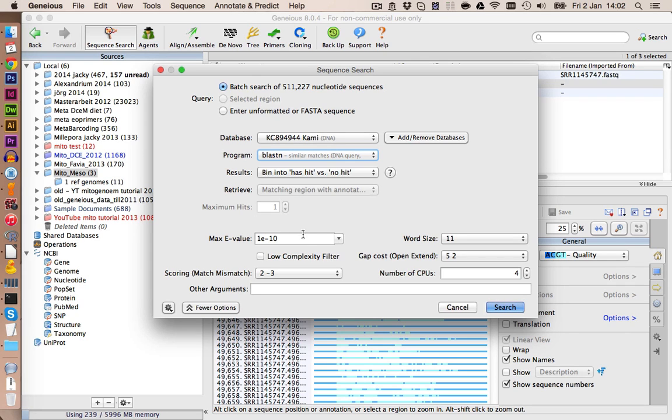You want to make sure that the low complexity filter is turned off, because if you turn it on, Geneious will prompt you with a message that your sequences are too short sometimes, and it will not continue the search until you click on OK on that message. So it's a bit annoying. However, we can avoid this by not turning the low complexity filter on, and then it will run the complete search without us having to click anything more.